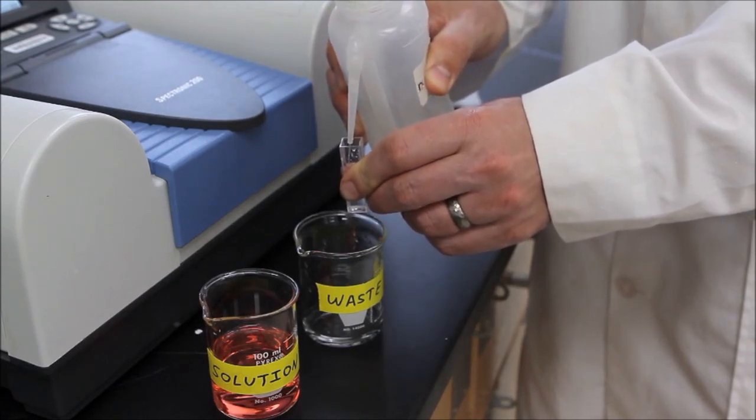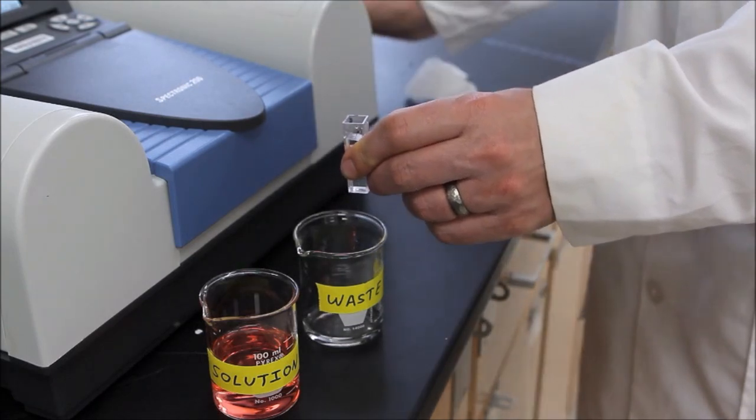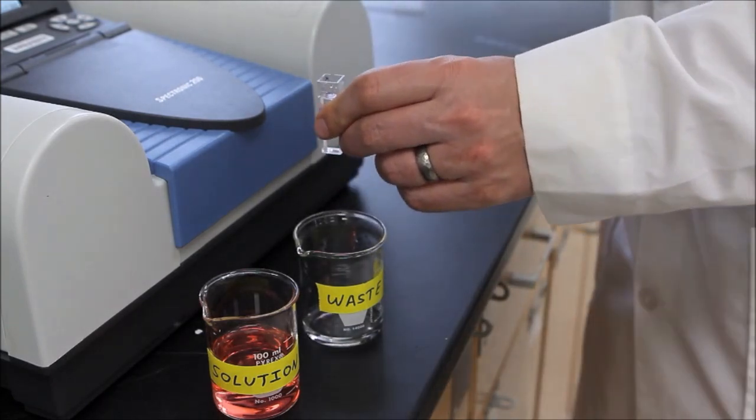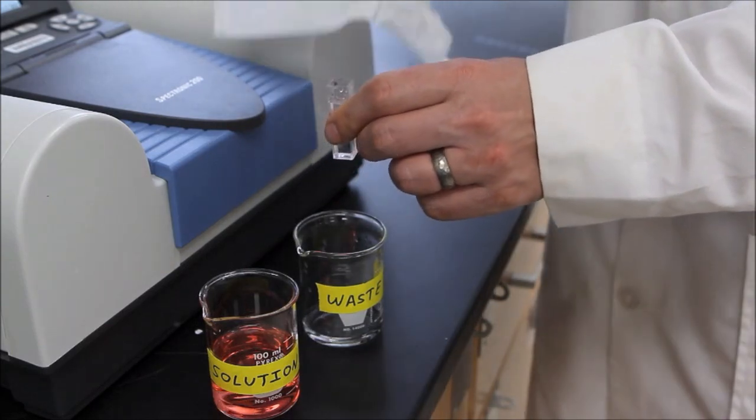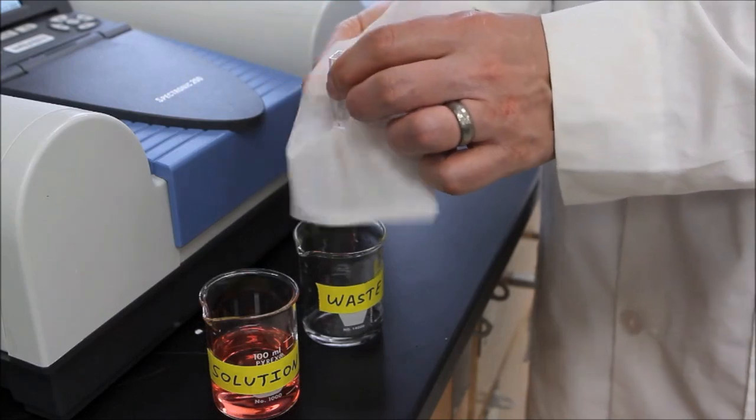Then fill the cuvette at least two-thirds full with deionized water, which will serve as our blank solution for this experiment. Finally, wipe the non-frosted sides of the cuvette with a chem wipe to remove any smudges that may be present.